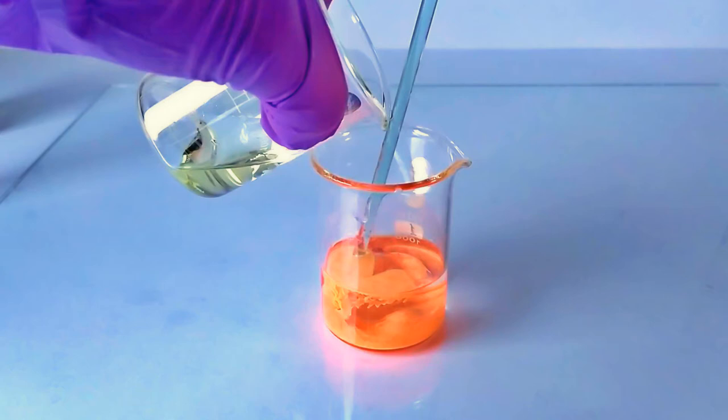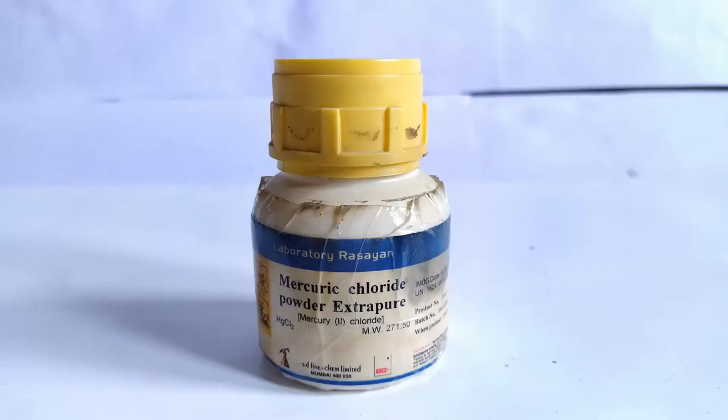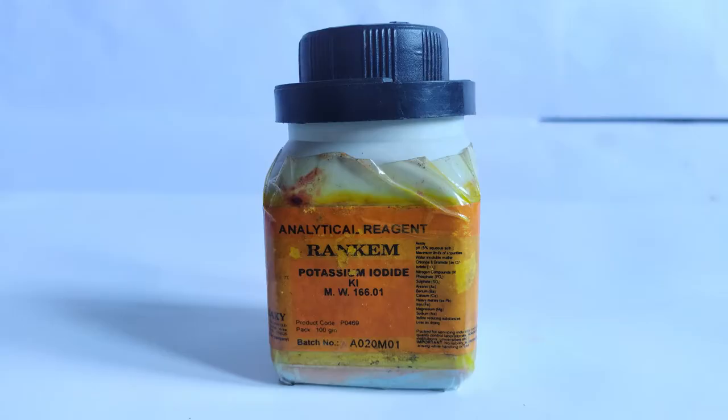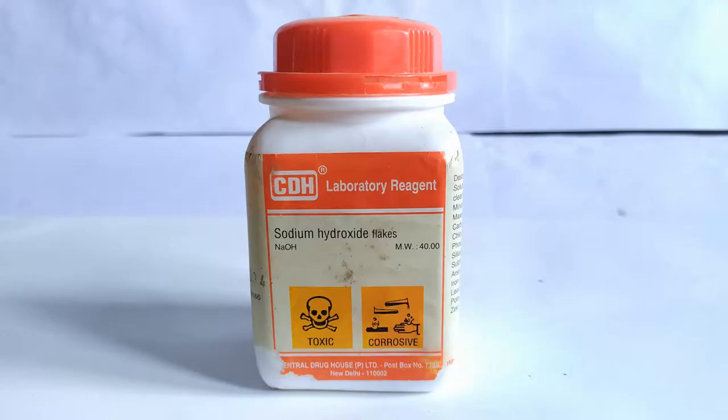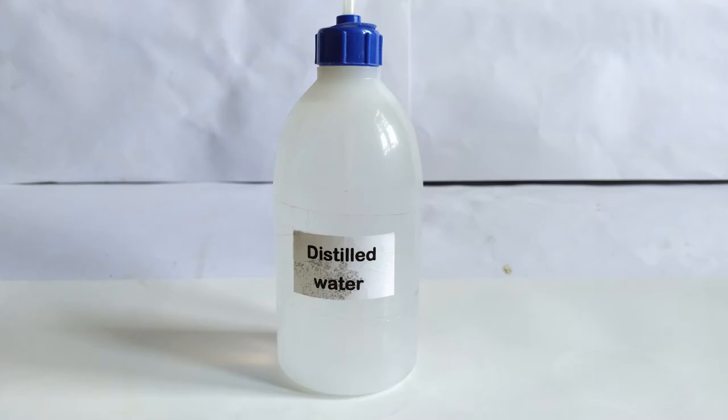To prepare the reagent you will need the following: mercury chloride, potassium iodide, sodium hydroxide, distilled water, and a weighing scale.